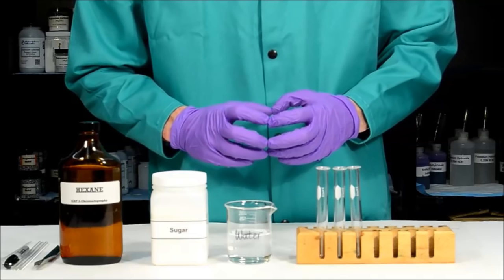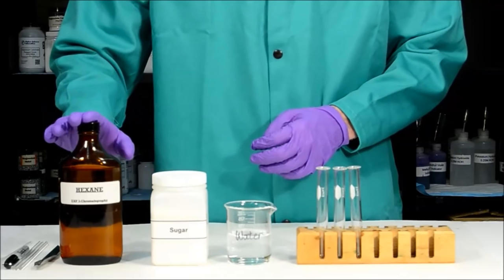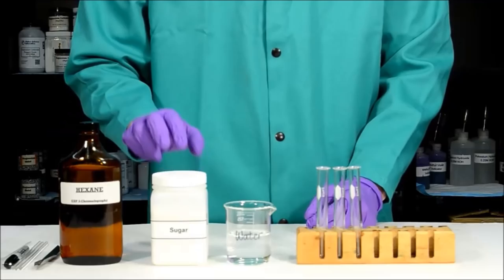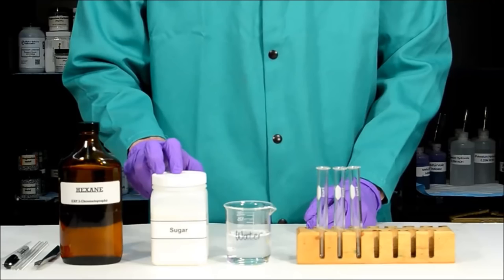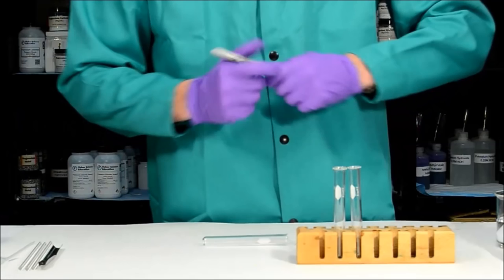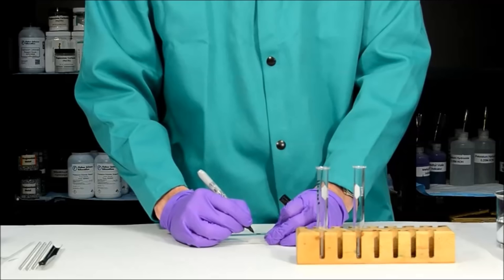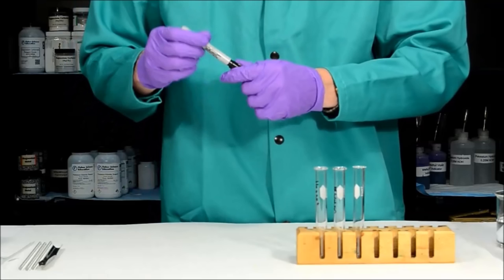Now let's look at the practical things you'll need to do in the lab. I have water and hexane — my solvents — and the solute sugar, which is polar. Before beginning, I need to add each solvent to a test tube. Since both are clear liquids, I'll label the test tubes first: one for hexane, one for water. We're doing this experiment qualitatively, so we don't need to measure exact amounts — just add an inch or two to the bottom. I'll pour a small amount of water into the first test tube, and use a pipette to transfer hexane into the second — it takes approximately two pipettes to get an inch or two.